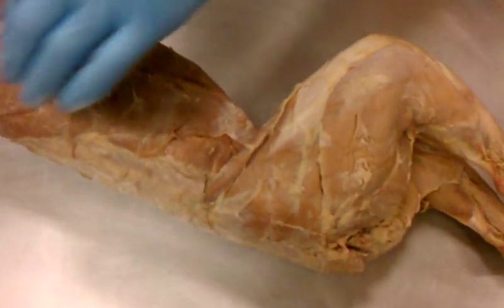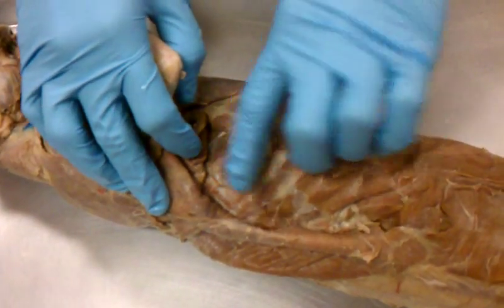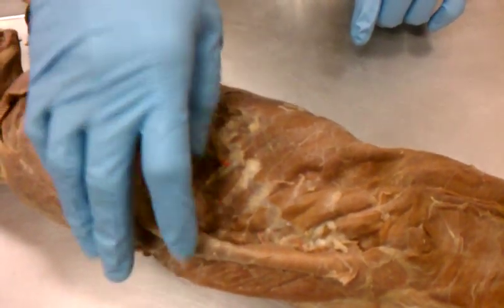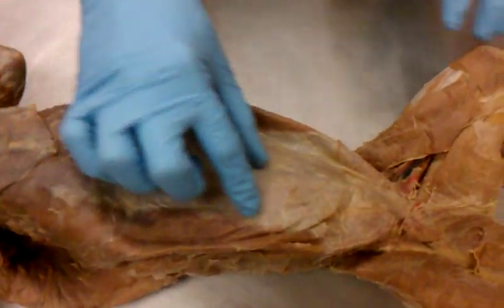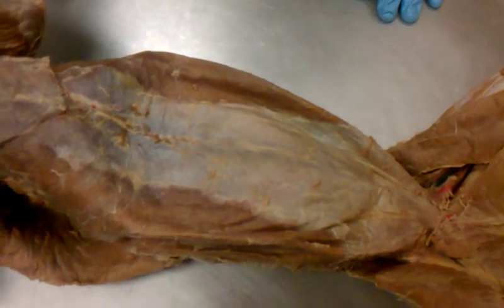And then you have these in between each of the ribs. Those are your external intercostals, because they're in between the ribs. What is the name of those? Rectus abdominis. Okay, and these that form your six-pack are your rectus abdominis. I think that's everything on the top.